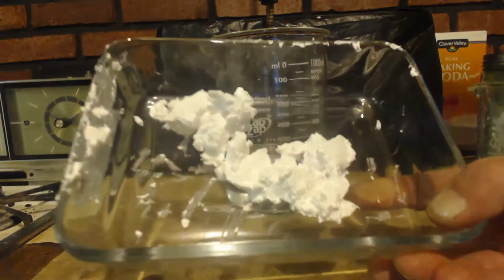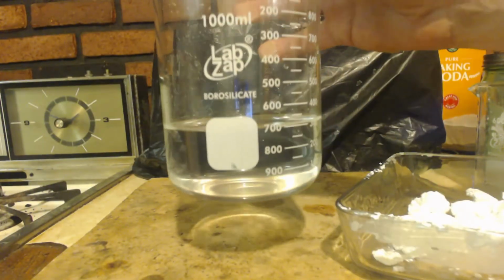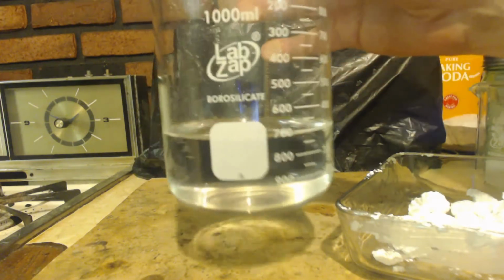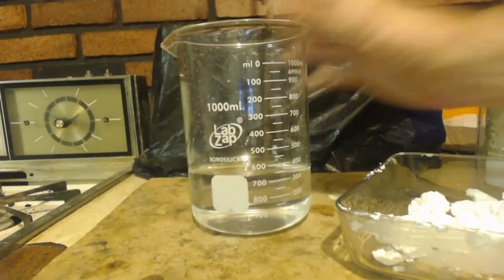And you can see I got some salt making it through the filter. So I'll filter this again. So there's the calcium sulfate I made. This is the stuff that got filtered through. I filtered it again because it had little particles in it. Now it's nice and clear. And I'm just going to boil this away.